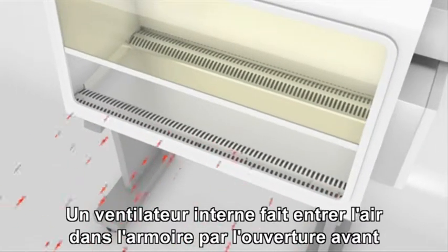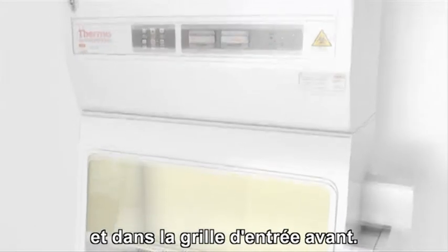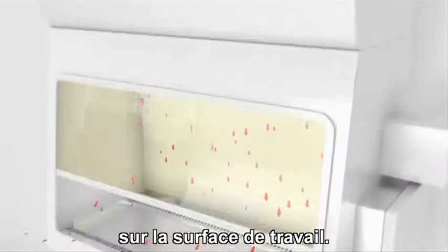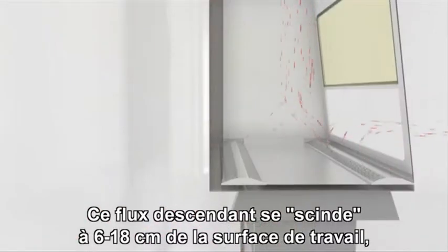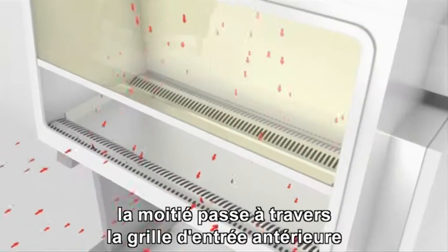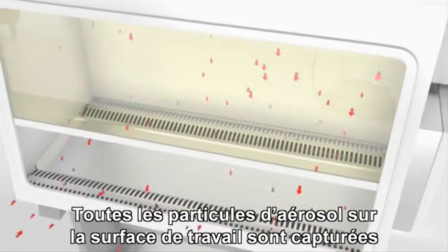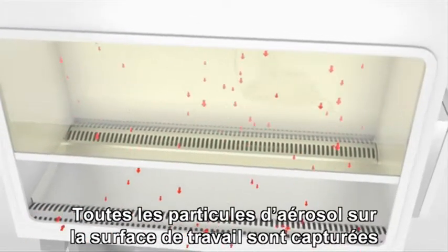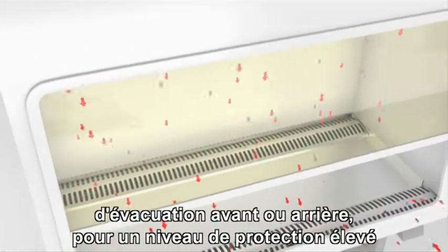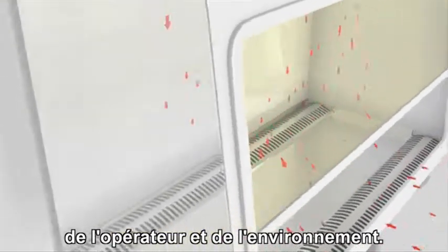An internal fan draws room air into the cabinet through the front opening and into the front intake grill. The air then passes through a HEPA filter before flowing downwards over the work surface. This downward flow splits about 6 to 18 centimeters from the work surface, one half of the air passing through the front exhaust grill and the other half passing through the rear exhaust grill. Any aerosol particles at the work surface are immediately captured in this downward airflow and pass through the front or rear exhaust grills, achieving a very high level of protection for the operator and the environment.